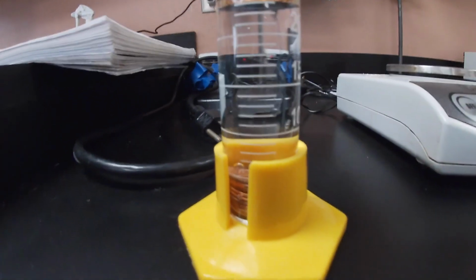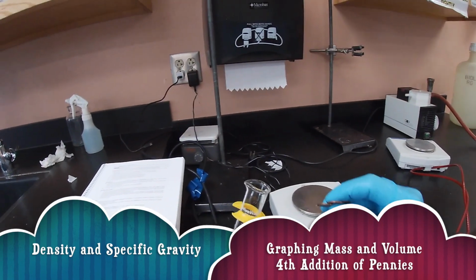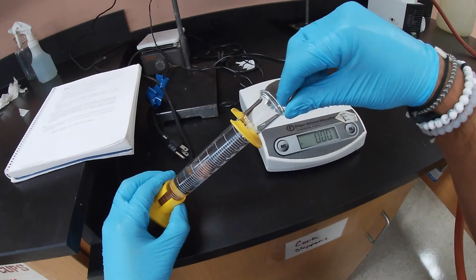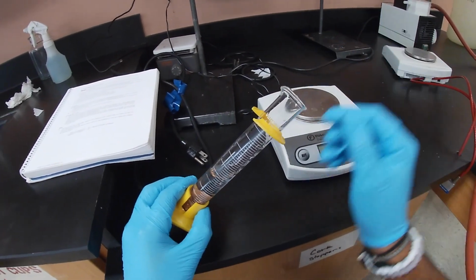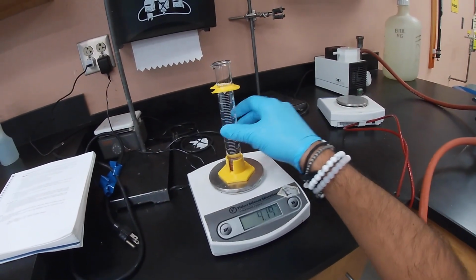Now we're going to do our last addition of the final 3 pennies. So far we have 9 pennies in there, so we'll have a total of 12 pennies. We add our first penny, second penny, third penny, and then we get the mass.